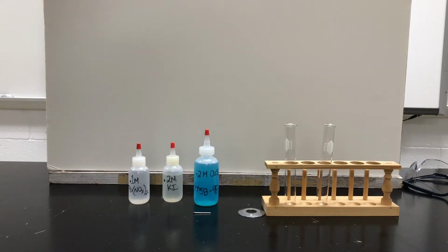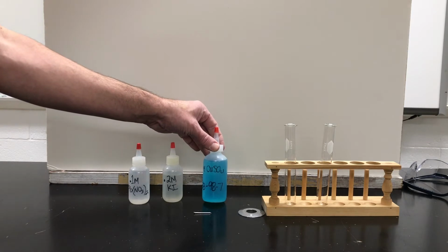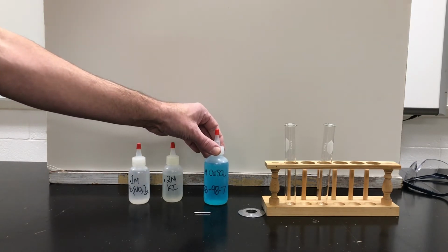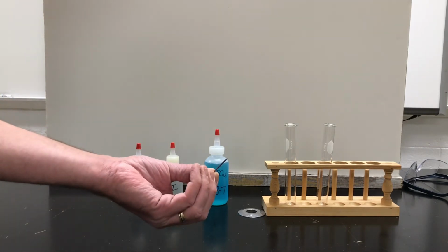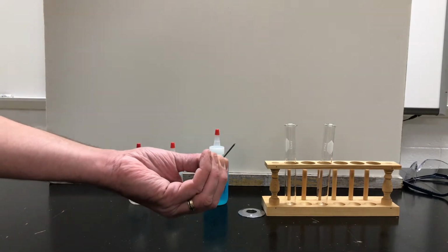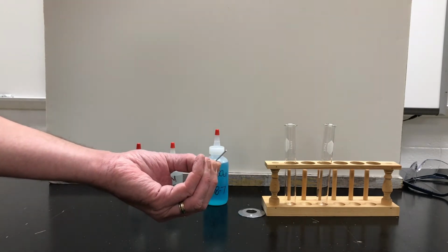Okay, so let's show you two more chemical reactions. One of them we did before, at the beginning of the year, where we took a solution of copper sulfate, CuSO4, and had that interact with a nail, a small shiny nail, which is basically iron, which is Fe off the periodic table. And we're going to have these interact.